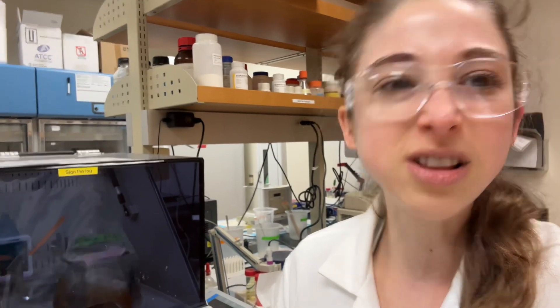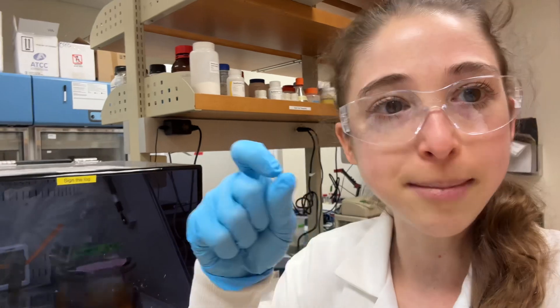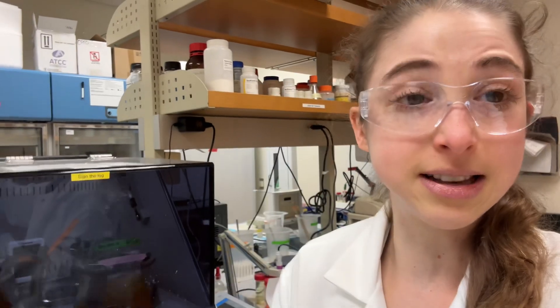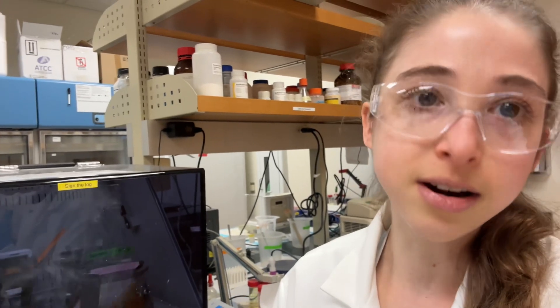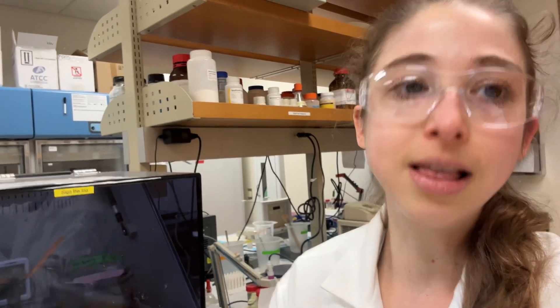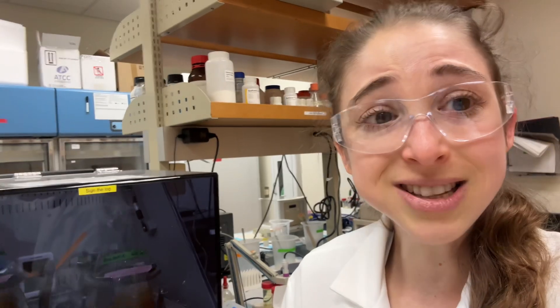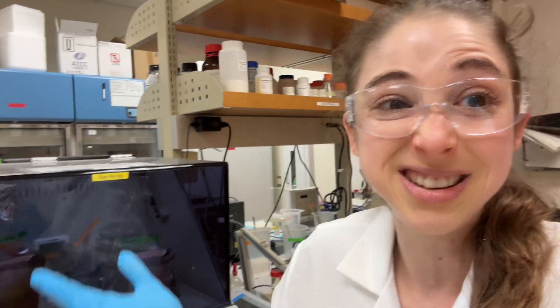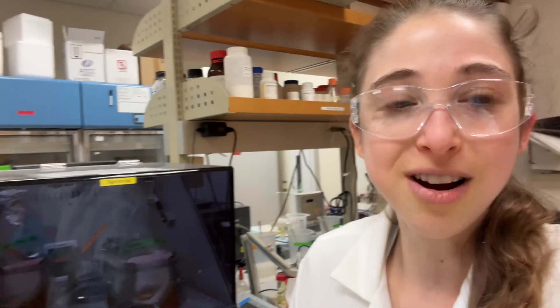I'm really excited to try it. I'm trying a simplified version. The original protocol from Studier et al. 2005 uses a complicated, chemically defined mixture — specific amounts of salts, sugars, and so on — and it's really hard to make because you have to mix all these ingredients at high concentrations and they don't dissolve well. I've tried that before and never actually got around to doing the auto-induction part — the media took forever to make. So I'm trying this new method where you just add glucose, lactose, and glycerol to your normal TB media, and the cells should grow and start making protein.